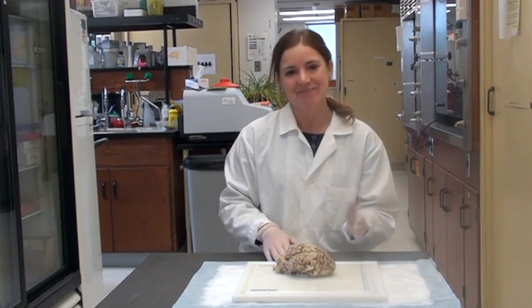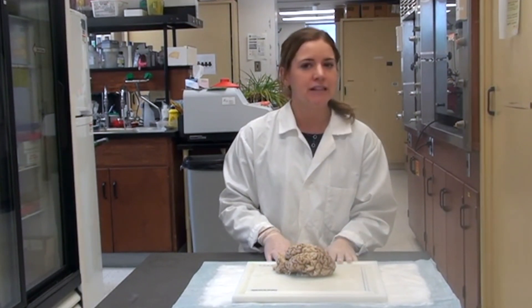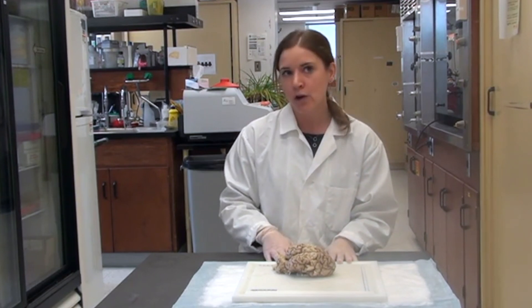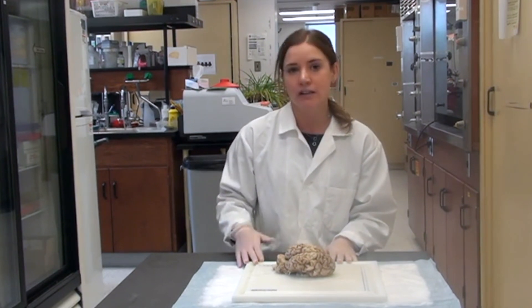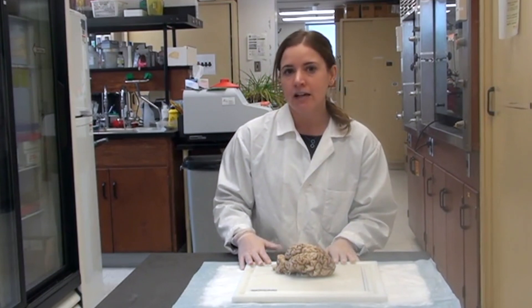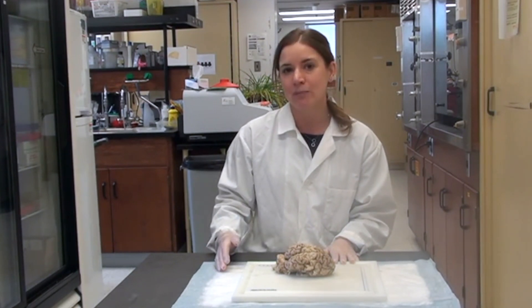So this is a brain — specifically it's a cow brain. Have you ever seen an animal brain before? Maybe a rabbit or a seal's brain? Or maybe you've seen a picture of an animal or even a human brain in a textbook or on the internet. Lots of things look the same across different kinds of animal brains. If you want to learn more about how different animals' brains are similar or different, you can check out the Brainreach North activity Brain Sizes.